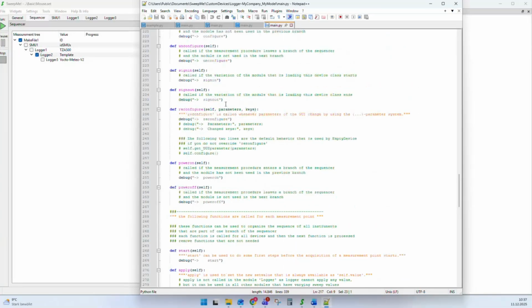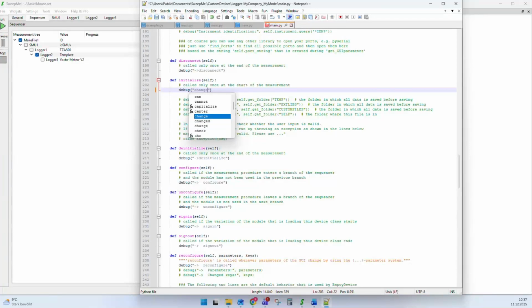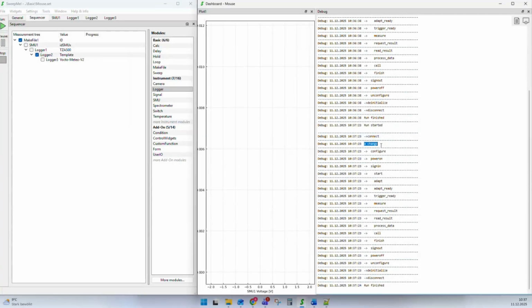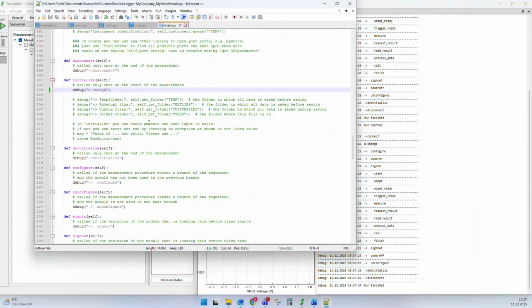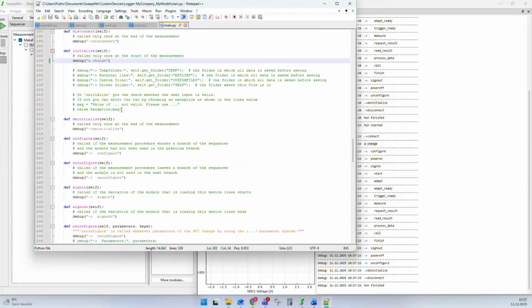Now we can simply change this driver. We go to initialize and, instead of initialize, we write something, a change. We save the driver, and if I run the code again, we can now see that it kicks out a change to the debug. So this is also a possibility to see how your code runs, in which phase you are, and now you can also start adding exceptions. Here's, for example, already an exception. Let's test this.